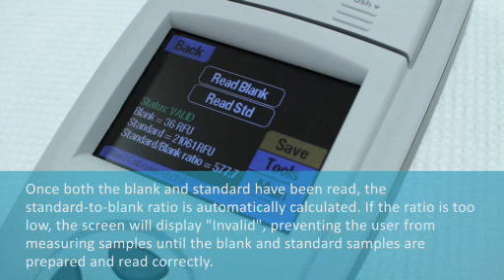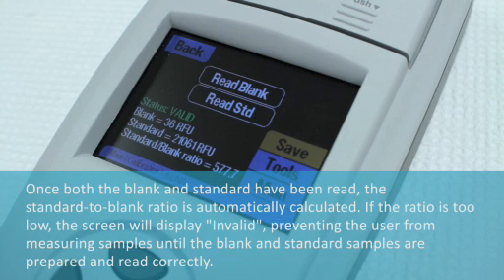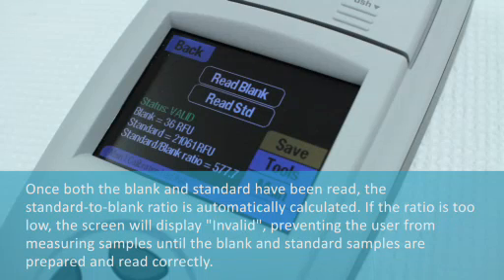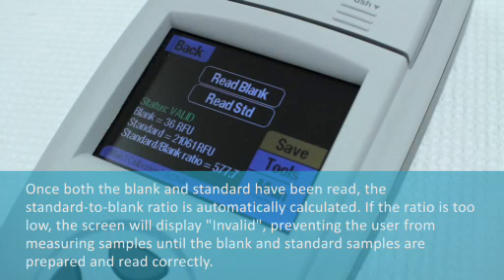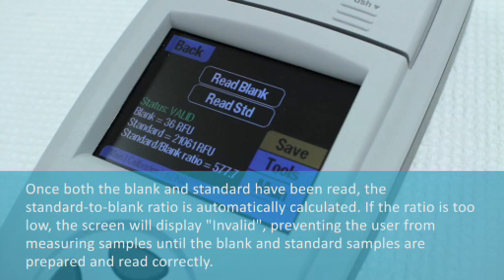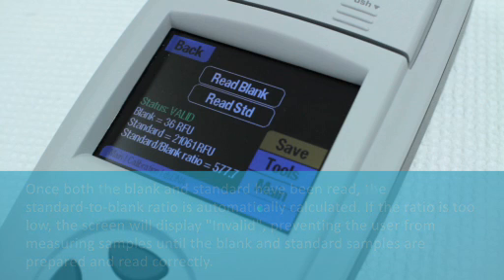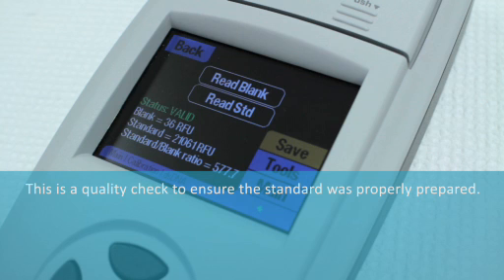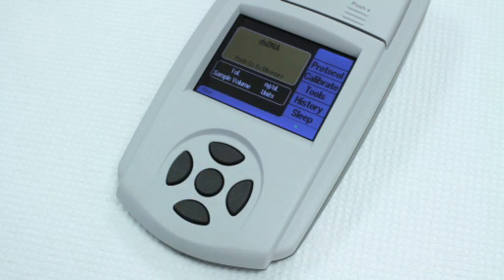Once both the blank and standard have been read, the standard to blank ratio is automatically calculated. If the ratio is too low, the screen will display Invalid, preventing the user from measuring samples until the blank and standard samples are prepared and read correctly. This is a quality check to ensure the standard was properly prepared. Select Save to save the calibration data.